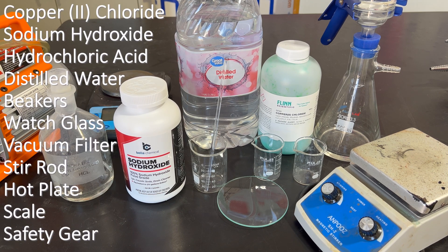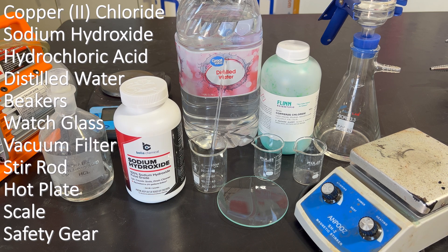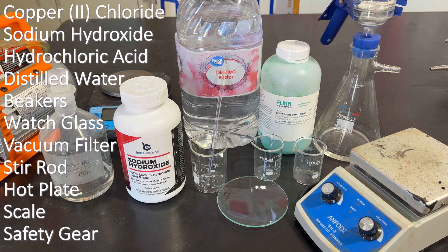Our materials today are copper chloride, sodium hydroxide, hydrochloric acid, distilled water, beakers, a watch glass, a vacuum filtration setup, a stir rod, a heat source, scale, and safety gear.